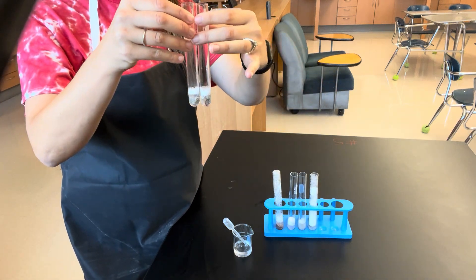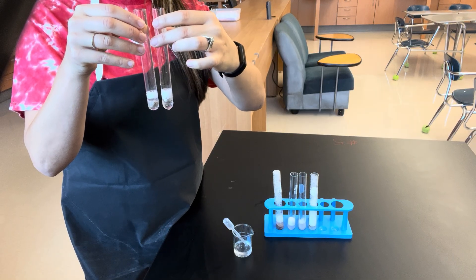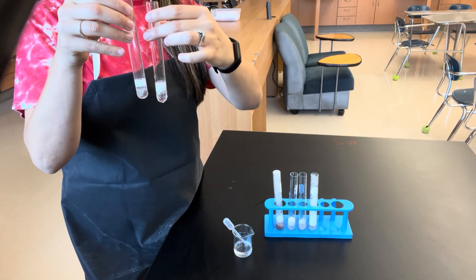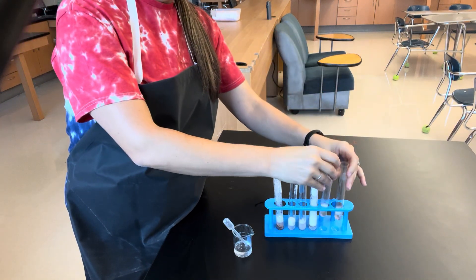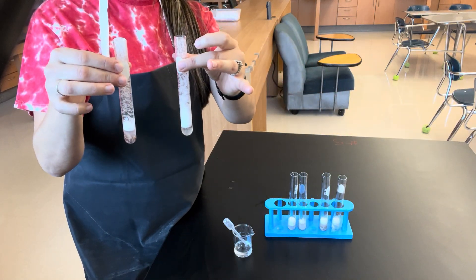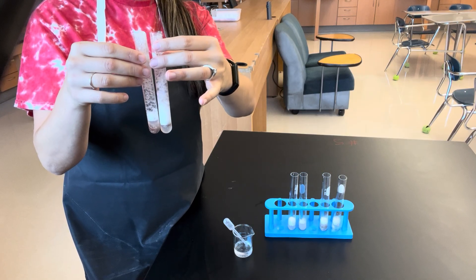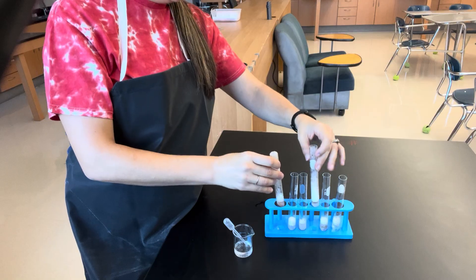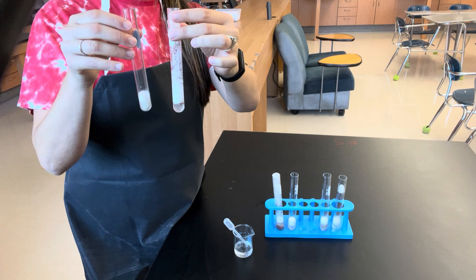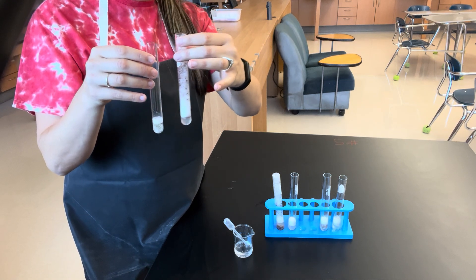It's important here to compare: we have acid here versus base, so look at what the reactions of those look like — they do look pretty similar, though the acid appears to be still reacting. Another important comparison is the raw versus the frozen: both of them bubbled pretty highly up the test tube. And then we also want to look at frozen versus cooked — you'll notice a pretty big difference in the reaction rates of those.